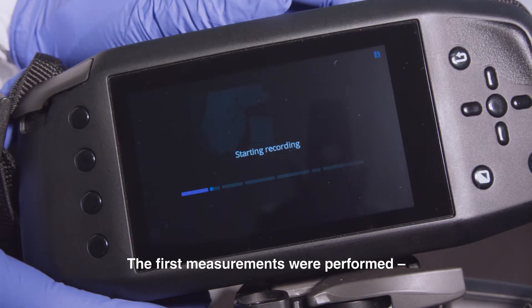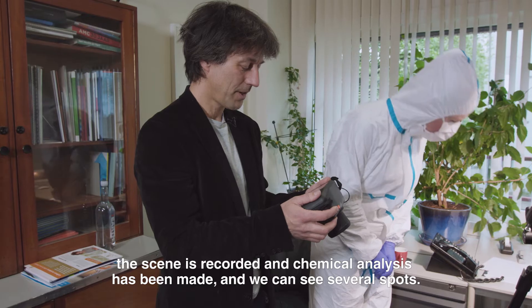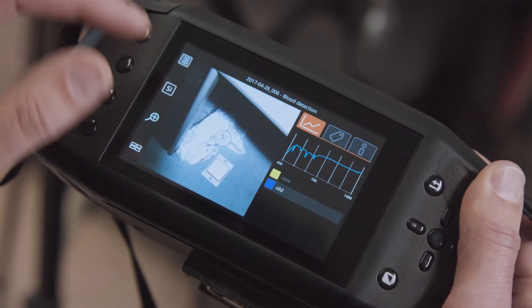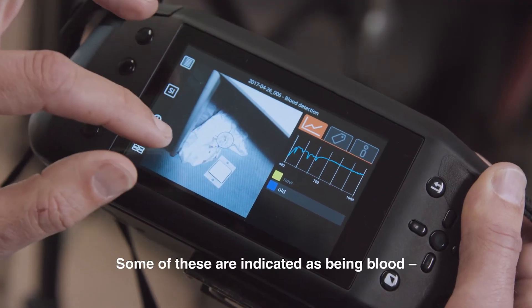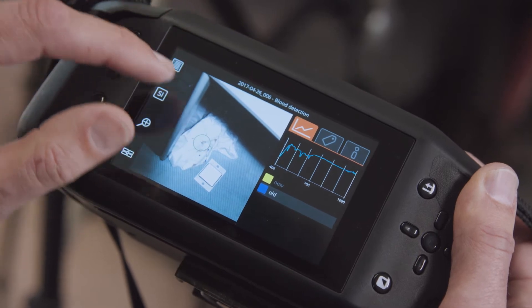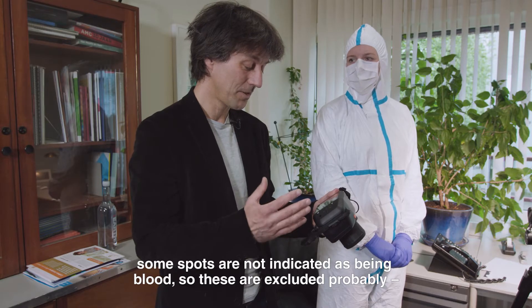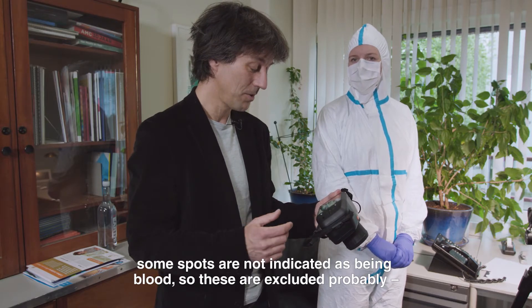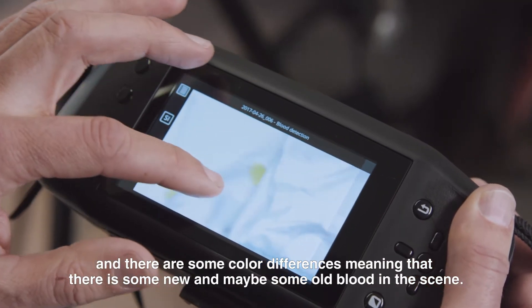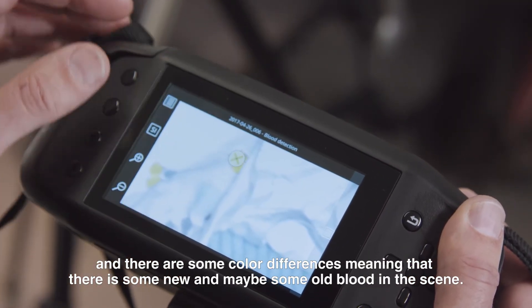So the first measurements were performed. The scene is recorded and the chemical analysis is made, and we can see several spots. Some of these are indicated as being blood, some spots are not indicated as being blood so those are probably excluded. And there are some colour differences, meaning there are some newer and some older blood in the scene.